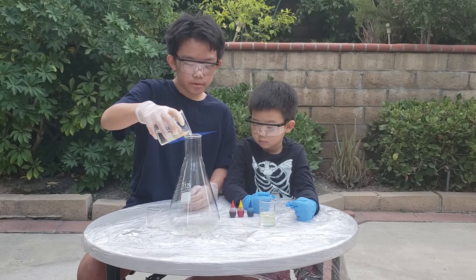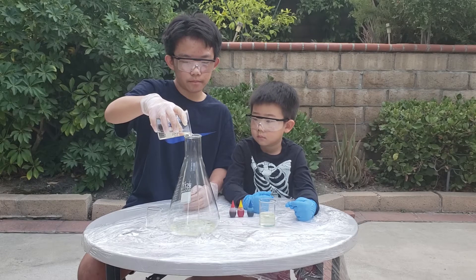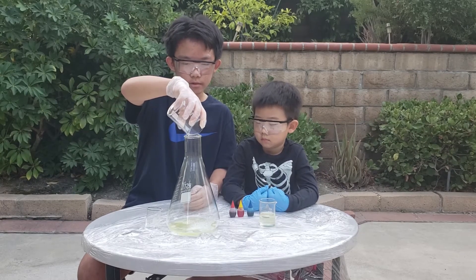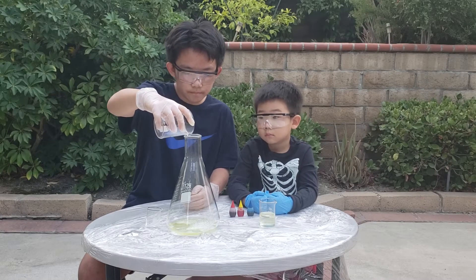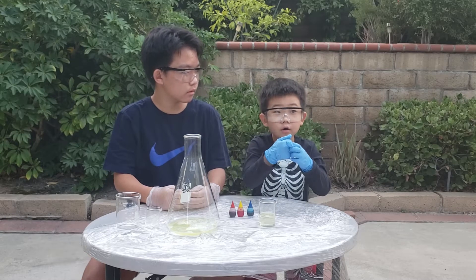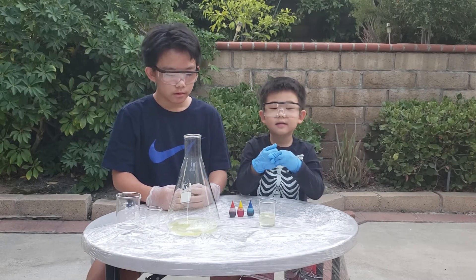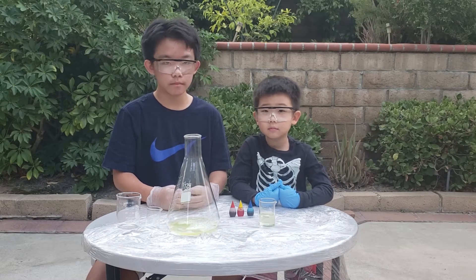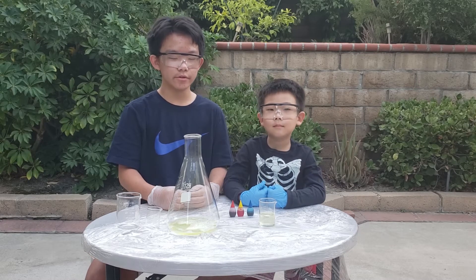Now remember, 30% hydrogen peroxide is not like the 3% you can buy at the store. 30%, unlike 3%, can cause burns on your skin instead of curing your cuts. If you touch it, it will turn your skin white and you must use water and lots of soap. This is because of the high concentration of hydrogen peroxide.